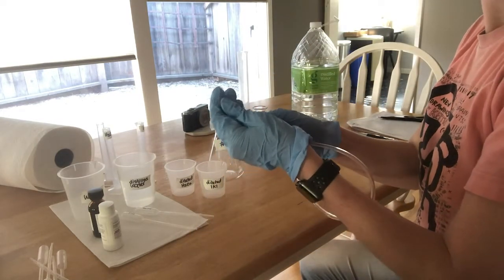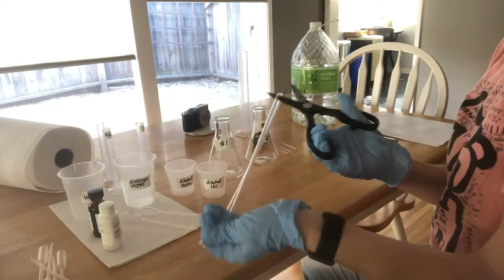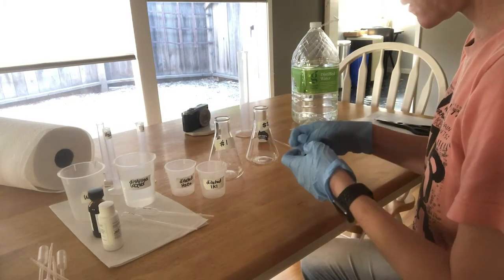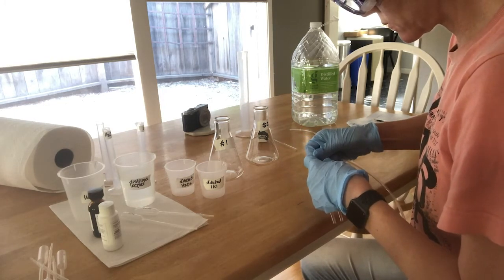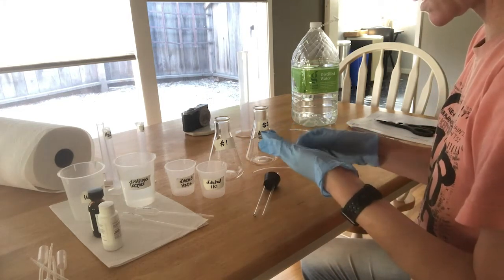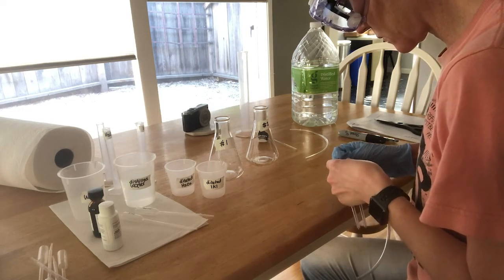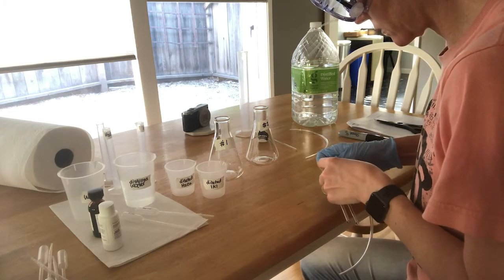You're going to be given a piece of tubing which is 24 inches long, and you want to cut it in half so you have two 12-inch pieces. Then you're going to connect the tubing to the smaller end of the glass tubing that comes out of the stopper. Be really careful when you do this — you don't want to force it on there because the glass is very delicate and you may break it. Be really careful and patient, and try to get it on there snugly so it doesn't fall off during the experiment.